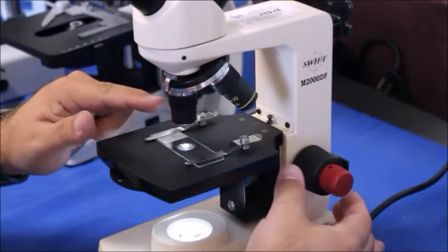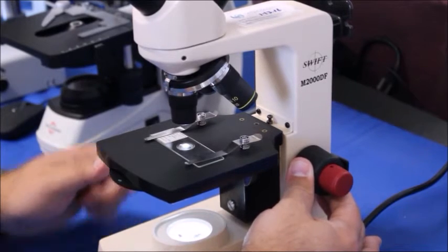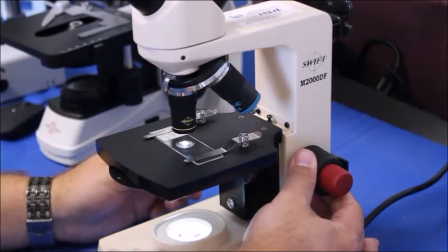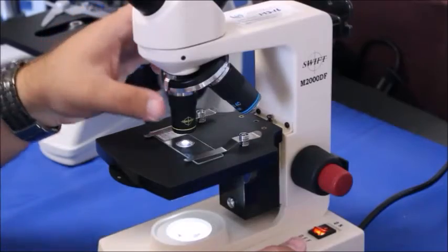Now we're going to switch this over to the 10x objective and look through here. You may have to do a little bit of adjusting with the fine focus, and you might see some different layers depending on what you're looking at.